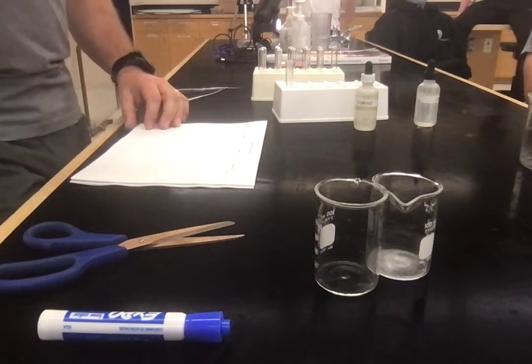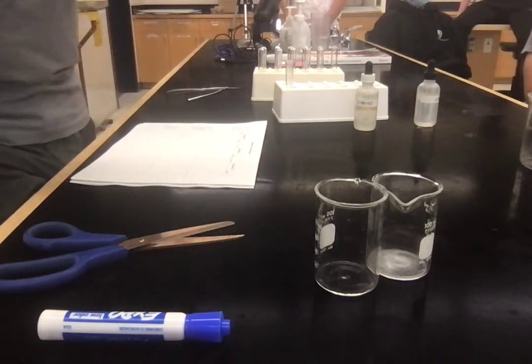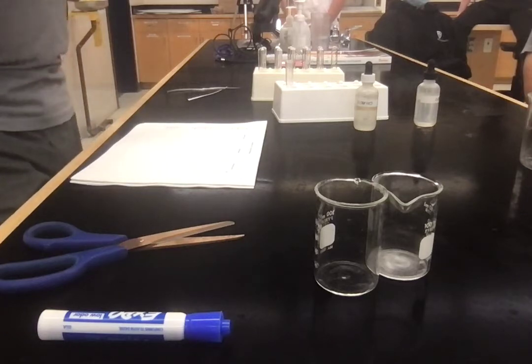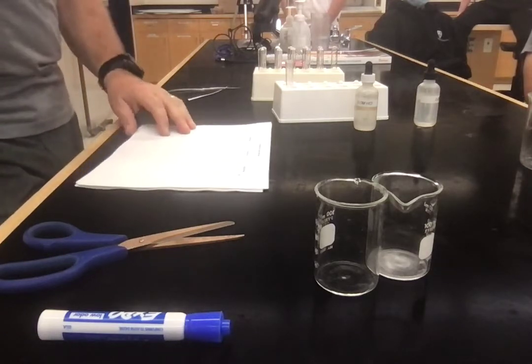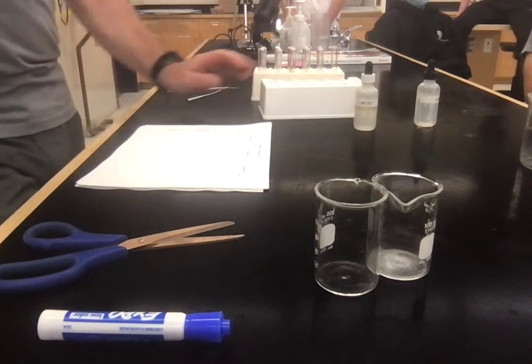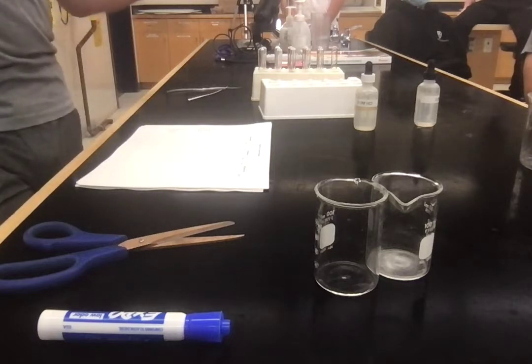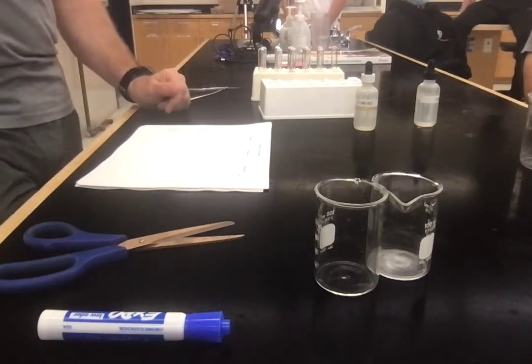What did you see, hear, those that touched it, what did you feel? And then think about, how do you think you could measure the rate of how fast this goes? By rate, we always have to do something over time. So something has happened over time.